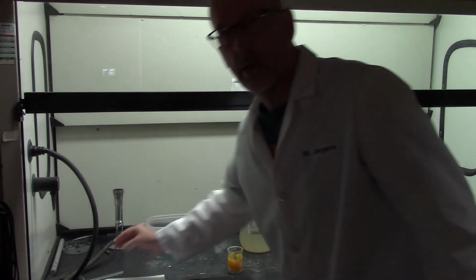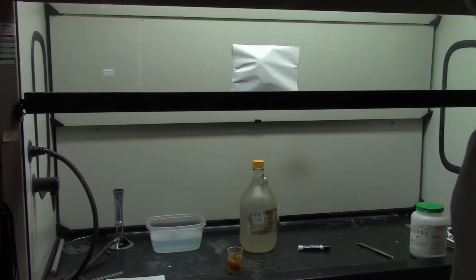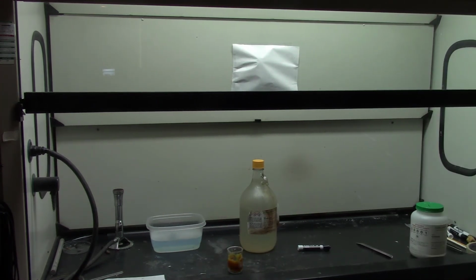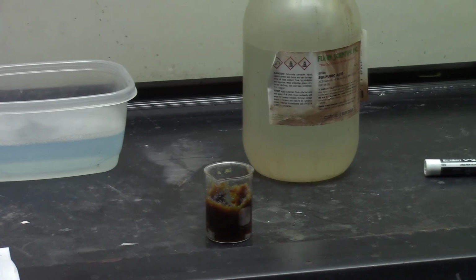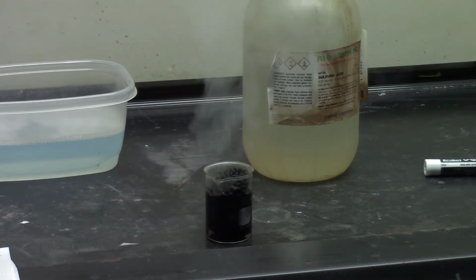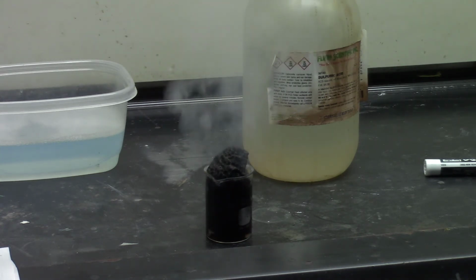All right, so there it is. Isn't that just incredible? Reaction occurring? Well, not much, is it? That's pretty boring. So let's see if we can go ahead and balance this. We now know that nothing happens during this reaction, so let's take a look at what could happen. Wait a minute, what is going on here?